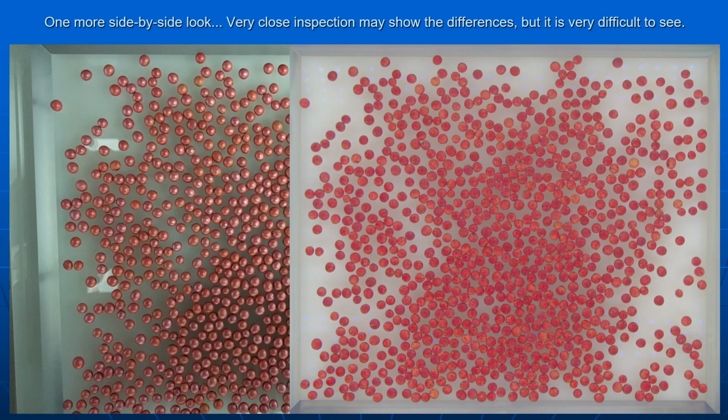In this side-by-side comparison, if you focus on a bean on the right-hand side, look at that same bean on the left, you're going to see a very similar picture. If you focus on a bean that's poorly treated, it may have a little bit less gloss in the other image, the untreated image, let's say, but there is still a significant difference in the treatment, and our measuring process picks that up.